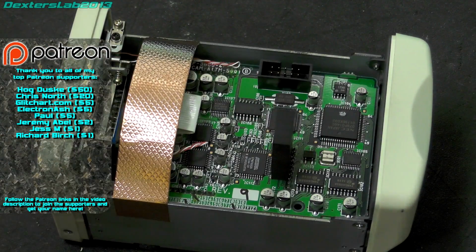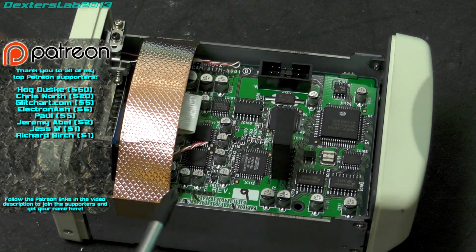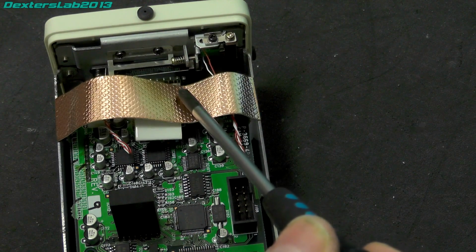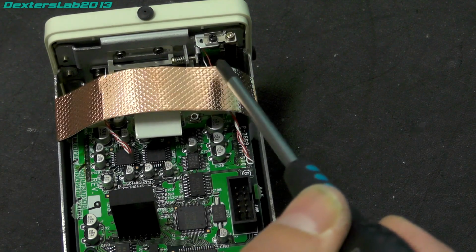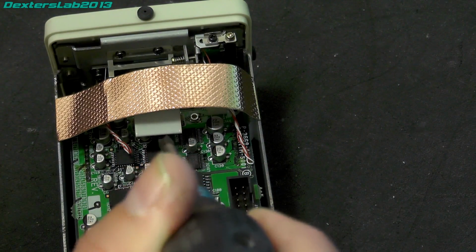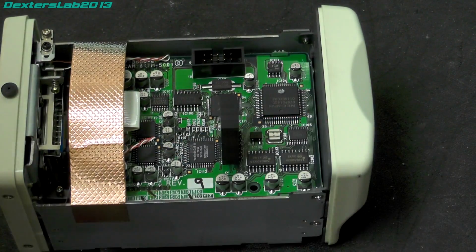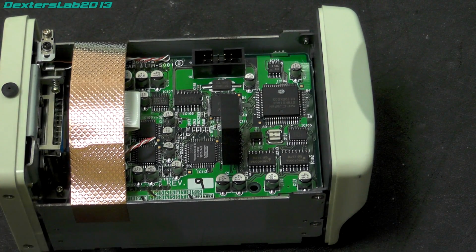So we've got a small pressed steel frame. I can see one board on the top end, there's another one underneath. The CCD is mounted here, and there is some kind of electrical structure going on there. I can see a couple of wires running over to a thing just in there, and there's another one down there. The CCD comes out on this flex to the top board, so that's going to be all the CCD driver stuff. So presumably the power and all the rest of it is underneath. So let's take the end bits off.